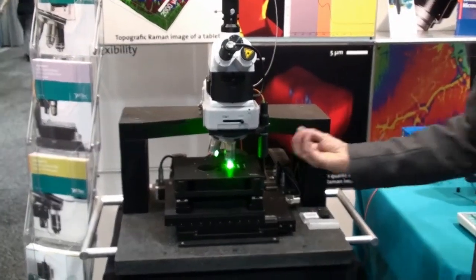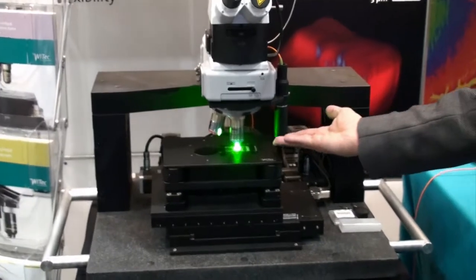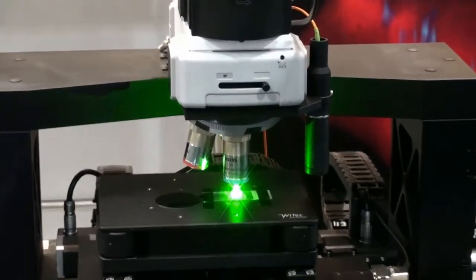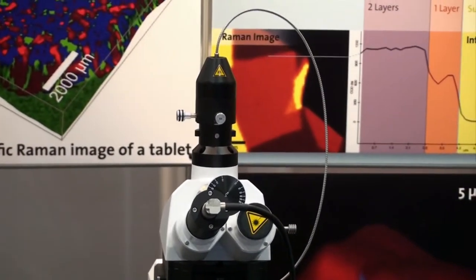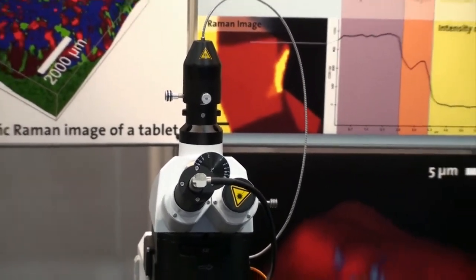It is a confocal microscope, which means only light from the focal plane can enter the microscope, because the fiber acts as a pinhole for confocal microscopy.